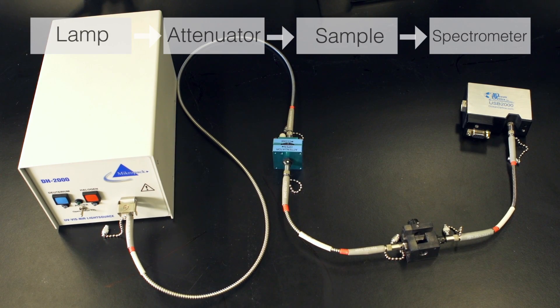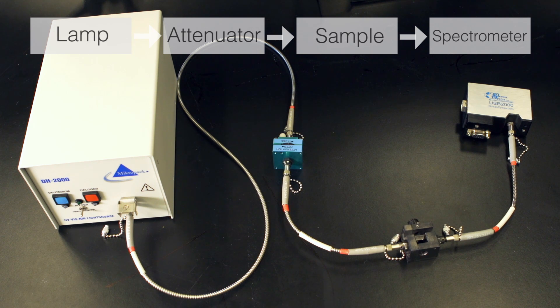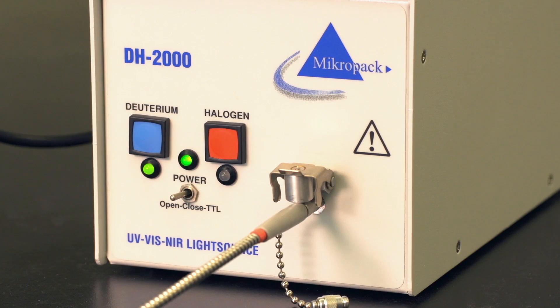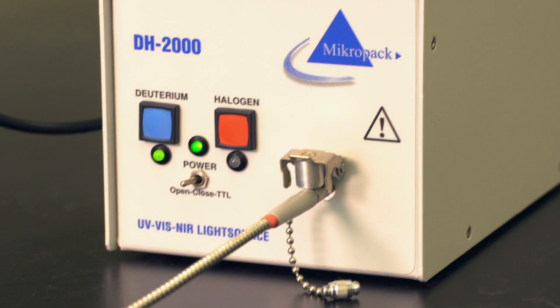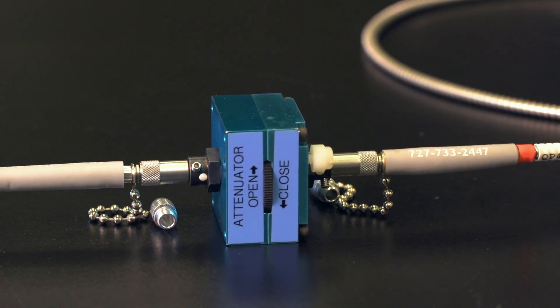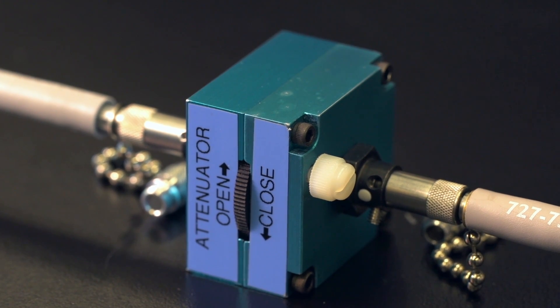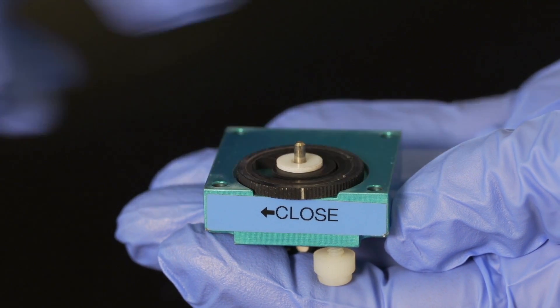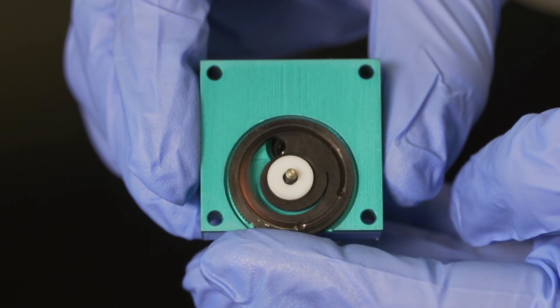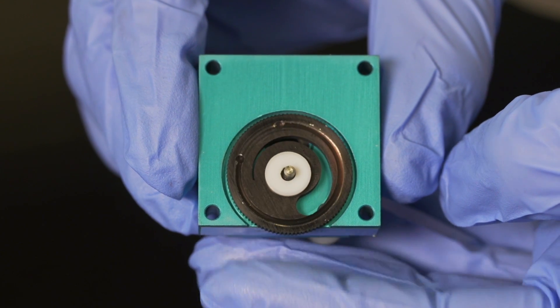This is the instrumental setup when the Ocean Optics is used to measure transmittance or absorbance. In this configuration, the path in which the light travels is straight. The light source is a deuterium lamp. The light beam moves through the fiber optic cable to the attenuator, which reduces the intensity of the light passing through. This is achieved by rotating the disc inside the attenuator, changing the gap in the plastic, to ensure the detector is not overloaded.